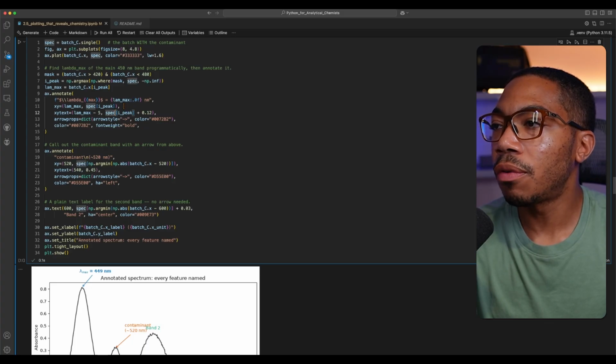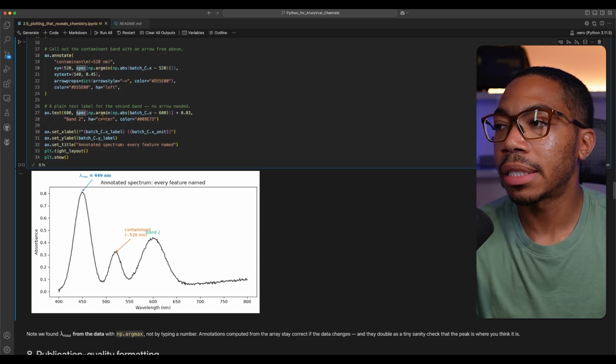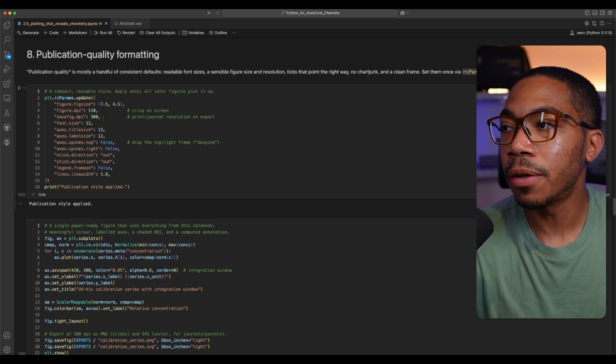And so this is a different way than using the axvspan I illustrated before, and oftentimes can be used in combination with it. However, it is worth noting that these annotations are done one at a time. You see I have an annotation for one of those points, the second point, and then we have something for the text as well. Now, admittedly, this next thing I'm going to tell you is something that's going to make your figures much easier to use, particularly for publications where you want high resolution figures, you want them to have a certain style, and instead of trying to make every figure look the same, you can set your parameters at the top of a notebook, and those will propagate throughout all of your figures.